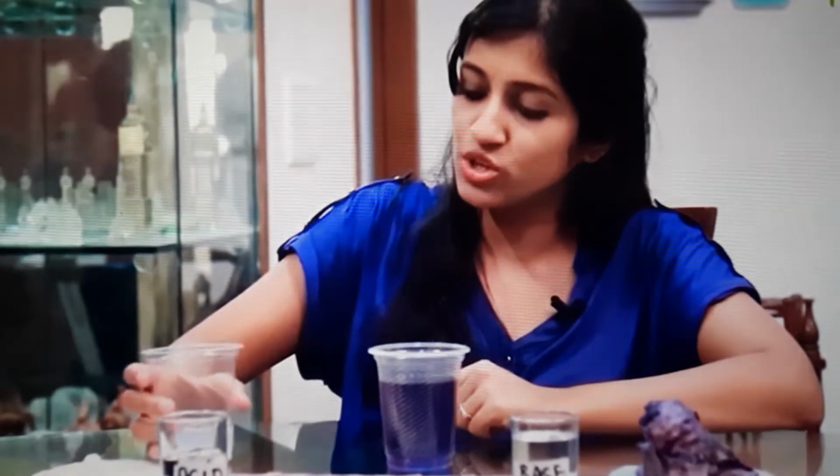An aqueous solution. What is that? That is nothing but taking some shampoo with some water in it to make a solution. So aqueous means something related to water and solution means a mixture. So a solution of water is an aqueous solution. So that's what I've done out of the shampoo. Let me get some more samples.